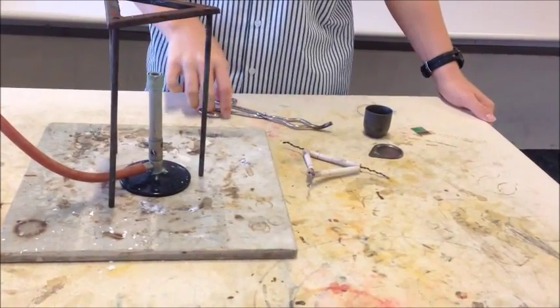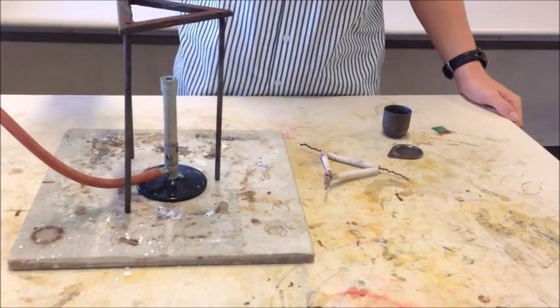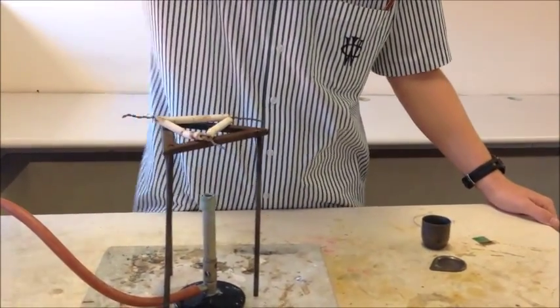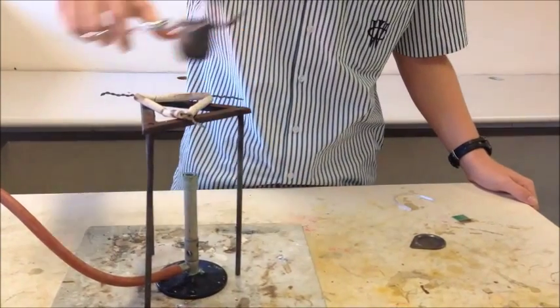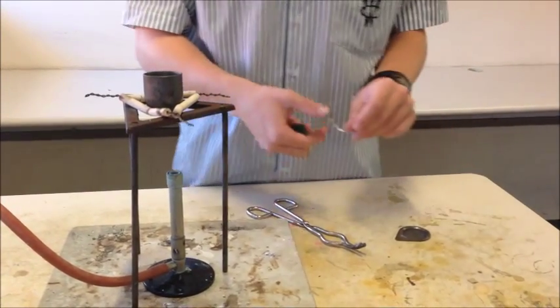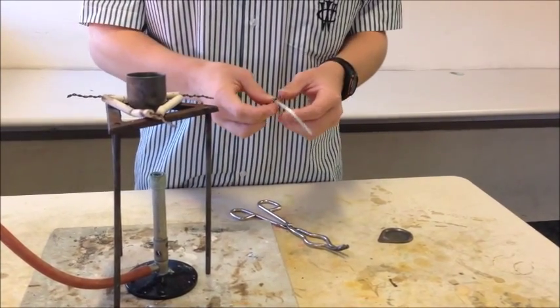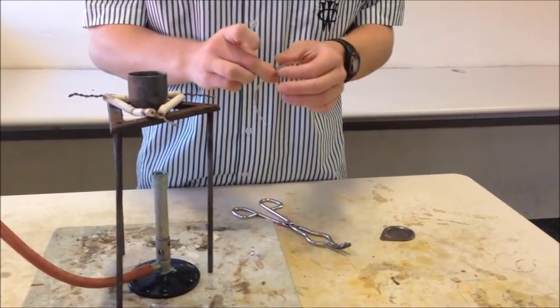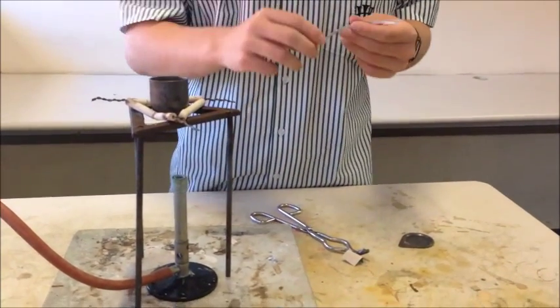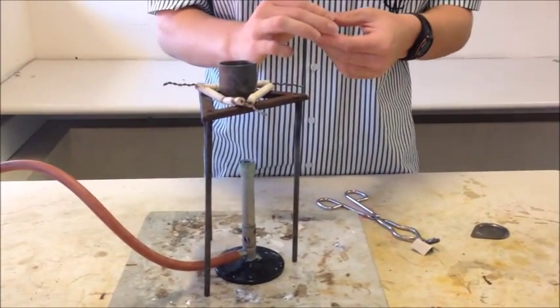To set up the experiment, you're going to need all the equipment that is required, being a tripod, Bunsen burner, clay triangle to place the crucible and lid, like this, and of course the magnesium and sandpaper. You're going to start by grabbing your magnesium and rubbing the sandpaper across it. This will stop oxidization happening on the magnesium ribbon. Then you're going to scrunch it up into a little circle so it's able to fit in the crucible.